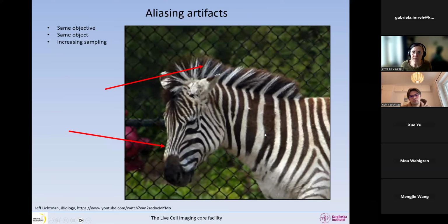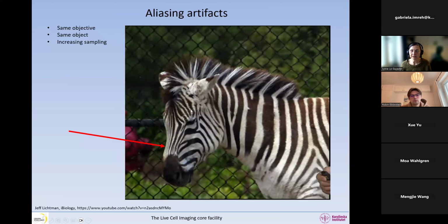So now we keep on going and we are sampling even better. So we start getting some nice definition of the zebra, but it still gets frizzy hair. And here we have a very strange pattern. Okay, slowly again, here is an even better digital resolution, but we still get these very fine details. You can see that what's left as we go with better and better digitalization is that the fine details are still not digitally resolved. So everything in here is resolved by the objective, and the other details are now well resolved, but only the finest details are not digitally resolved.